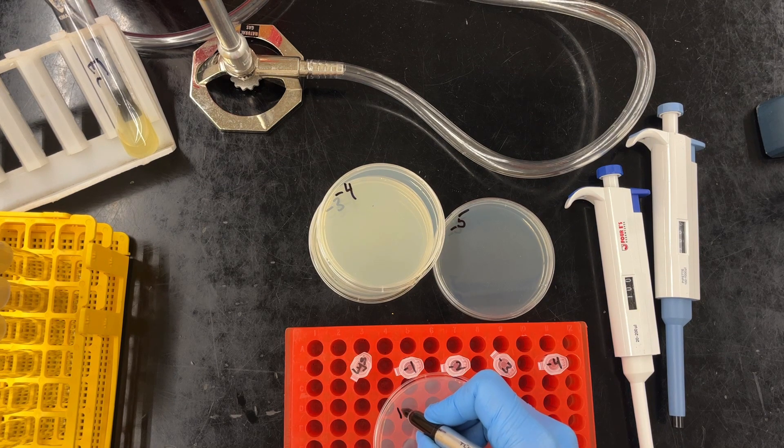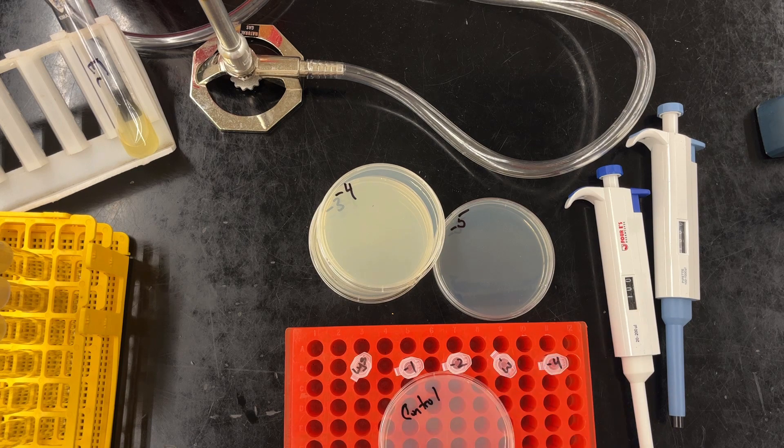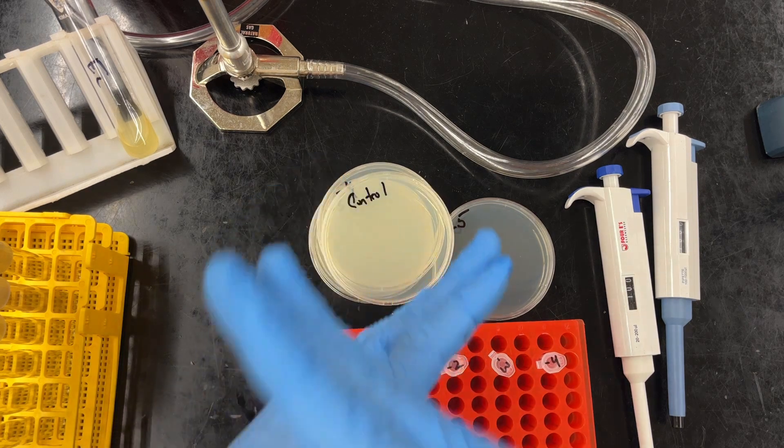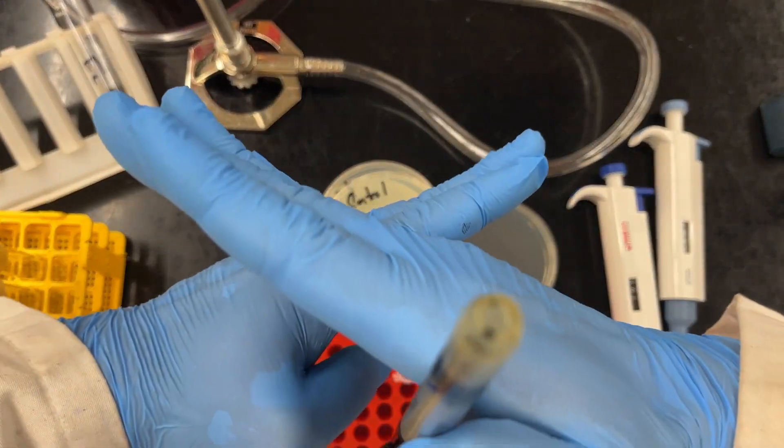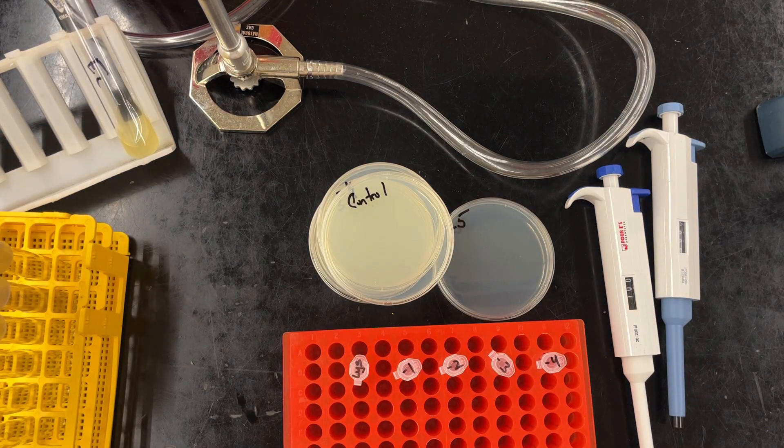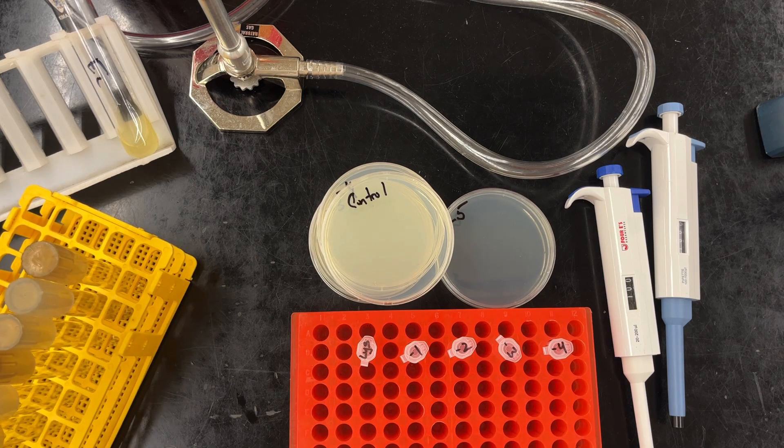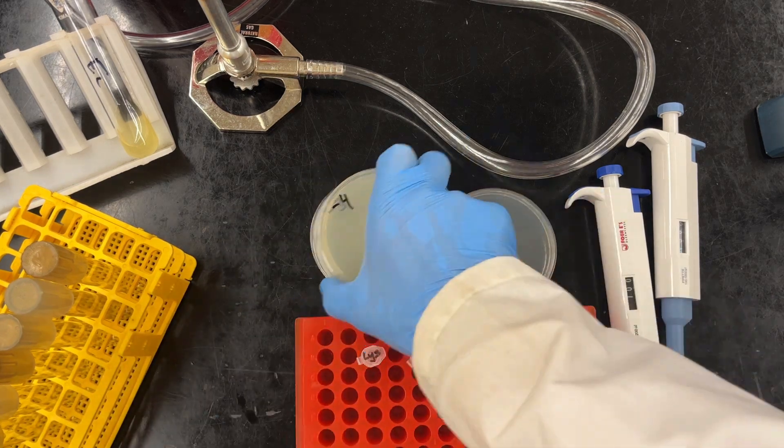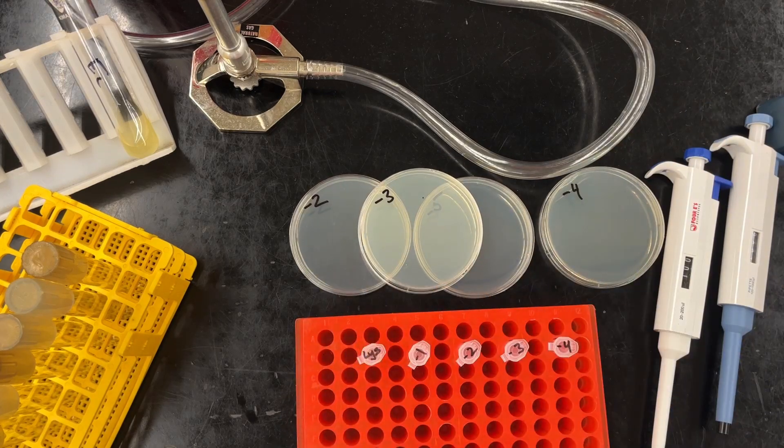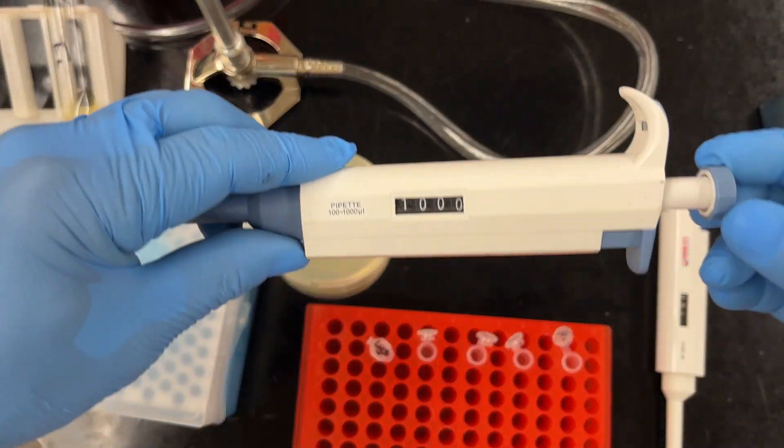We will not be doing this as our class activity. I just wanted to show you all what it looks like when there are no bacteriophages. So yeah, you're not doing it. This is for demo purposes only. In fact, during the class activity we will probably change the dilutions that you will be doing. I like to stack my plates in kind of the order that I'm going to plate them, have everything set, and let's begin our dilutions.